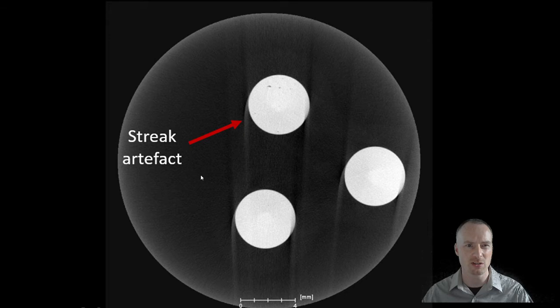In X-ray computed tomography, streak artifacts cause a particular problem in post-processing. In this example, we can see a streak artifact on the edge of the specimen, and the effect is replicated on the opposite edge. This also occurs for specimens number 2 and number 3. In post-processing, the streaks can give a false edge to the specimen dimensions.